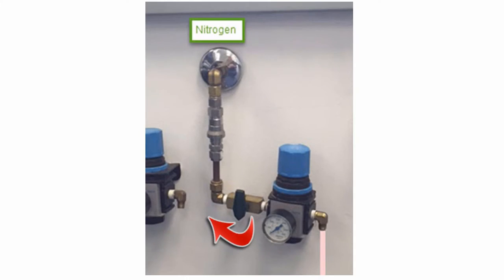If the mass spectrometer will be vented and out of service for more than 8 hours, then turn off the nitrogen gas supply.